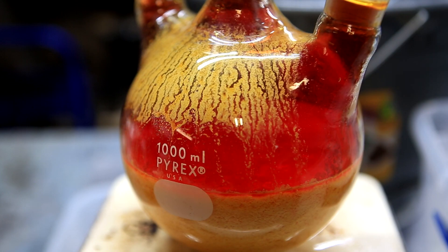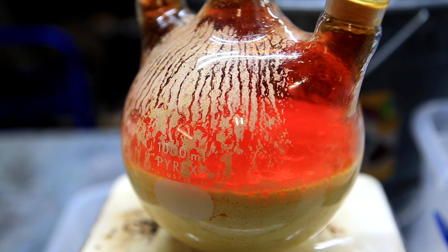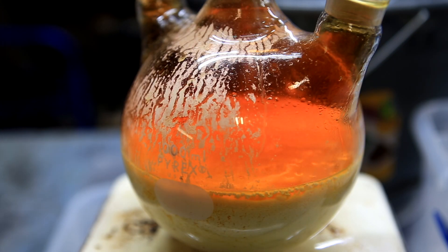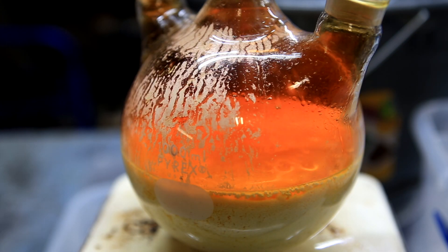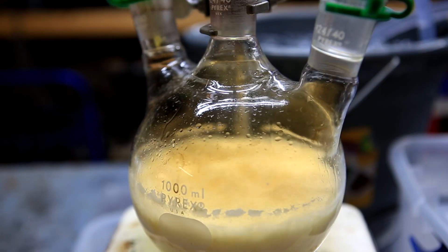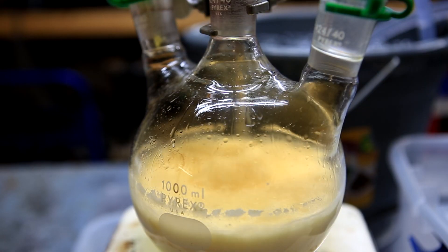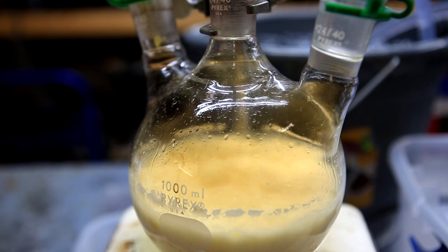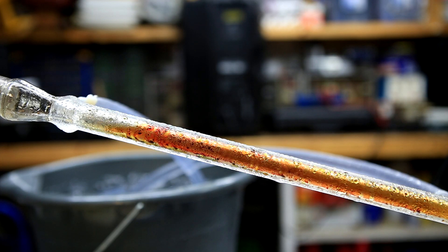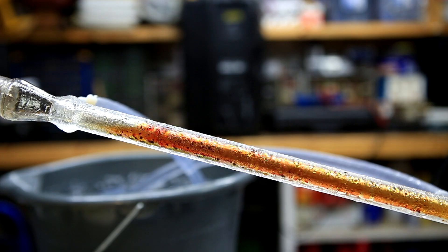The reaction mixture was boiled at 100 degrees Celsius until it completely cleared up. It should reach a point where you don't see any bromine vapors in the distillation flask. Once this point is reached, the distillation is done and the flask can be removed from heat. You can see at this point that only water is coming over and not a mixture of water and bromine.